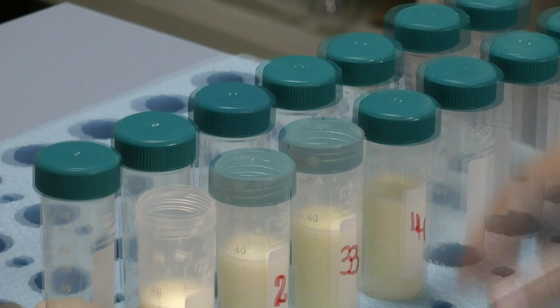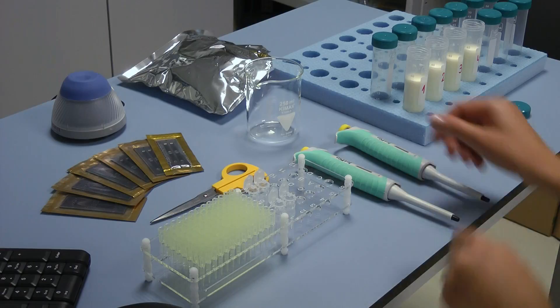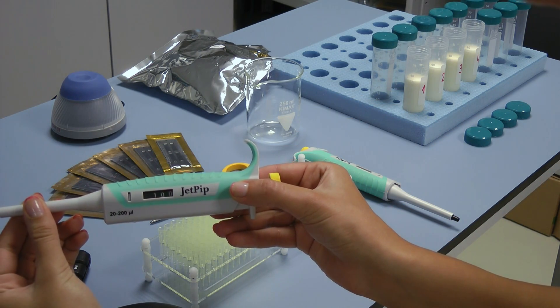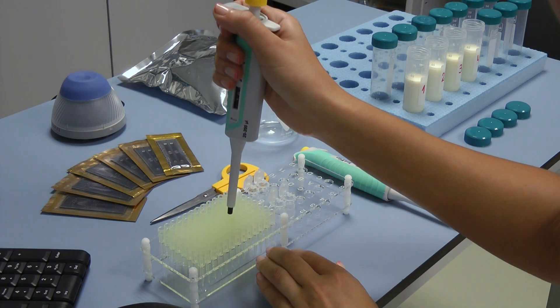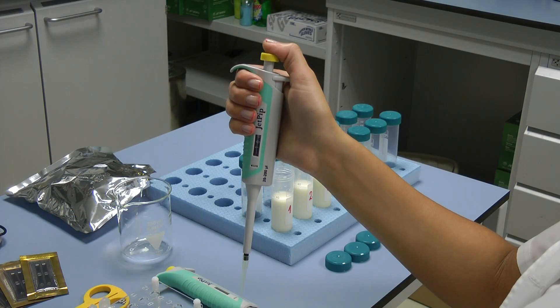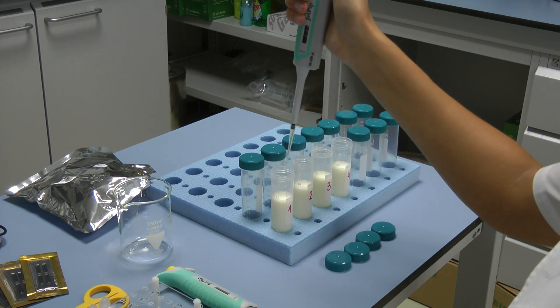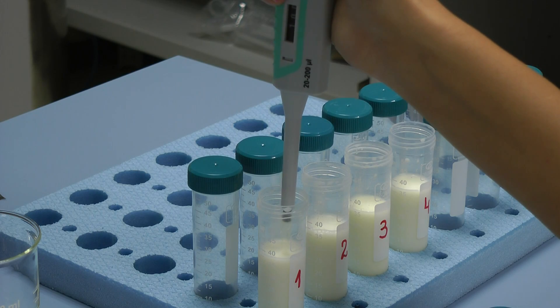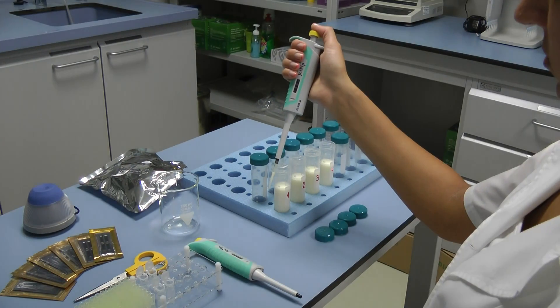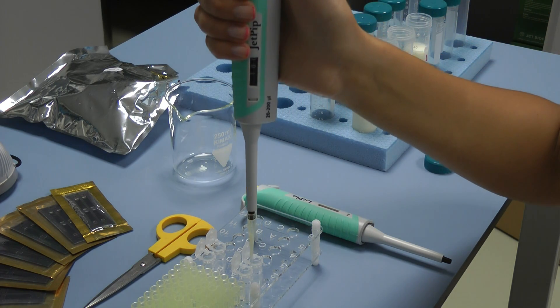When finished, open the sample's clamps. Take a pre-set 100 microliters automatic pipette. Place it vertically over one of the tips on the working rack and place the cone of the pipette in the opening of the tip by slightly pressing it. From initial position, press the working button of the pipette till the first stop is reached. Keep it pressed and dip 2 or 3 mm of the tip in the milk. Smoothly release the working button and take out the tip from the liquid. Touch the walls of the bottle to remove the excessive milk.